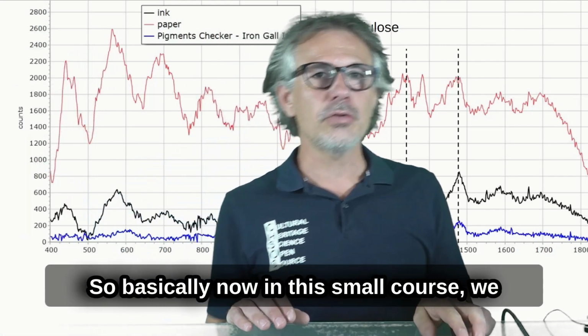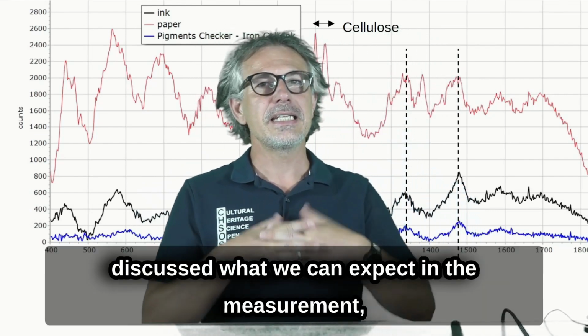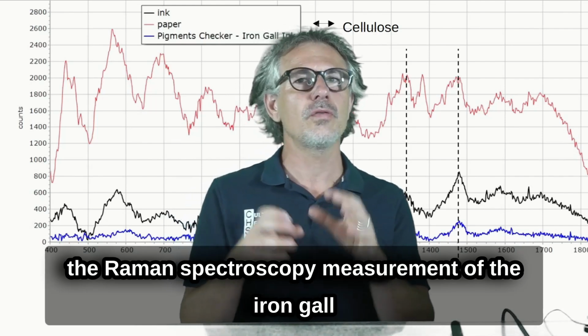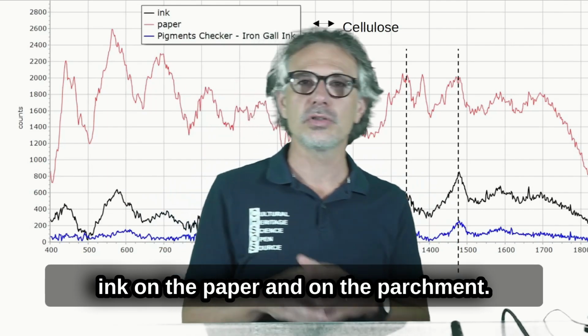So now, in this small course, we discussed what we can expect in the Raman spectroscopy measurement of the iron gall ink on the paper and on the parchment.